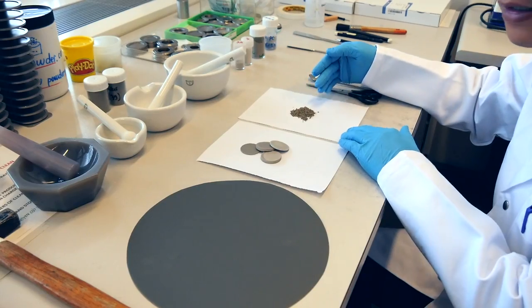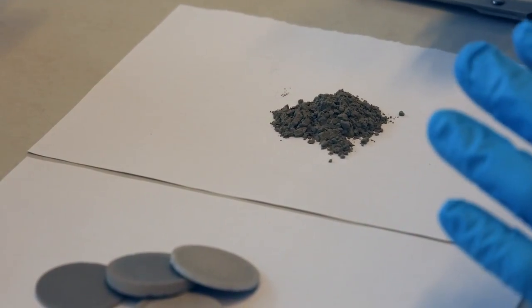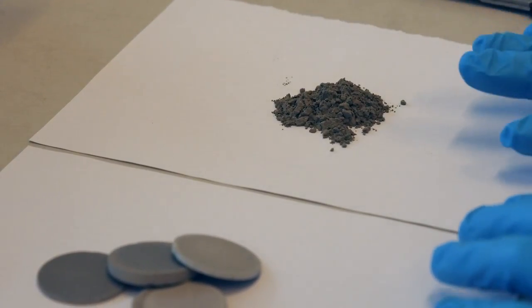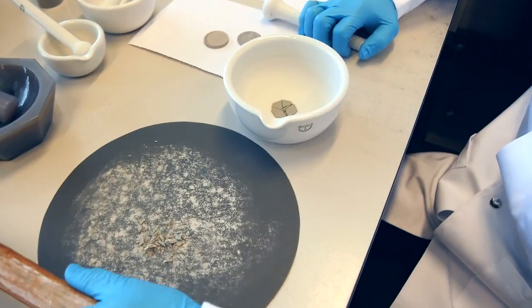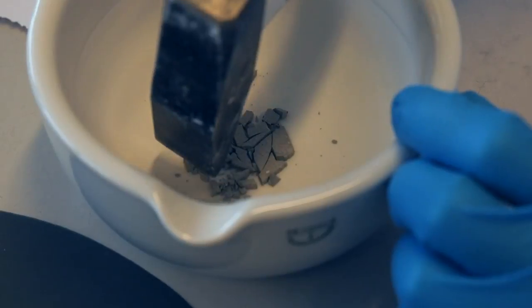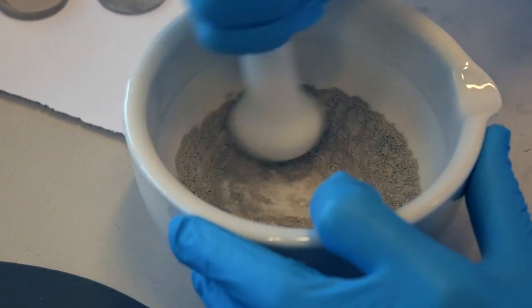In this video, we are going to show you how to prepare the sample for XRD analysis. The typical samples used are powders. The fineness of the powders should be at least less than 20 microns and ideally 1 to 5 microns to ensure good particle statistics. If the samples are not yet powdered, a mortar and pestle can be used to comminute the sample. Wet grinding is preferred if you want to grind the particles very fine. Another way to improve the statistics of the powders is to spin the sample.